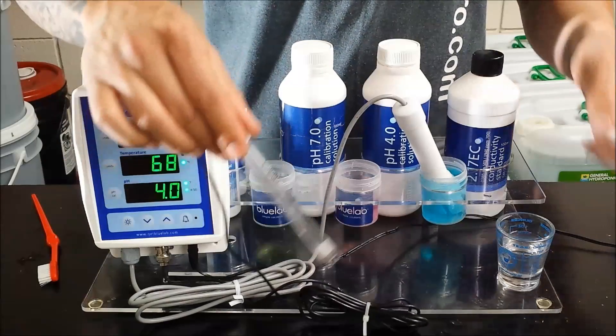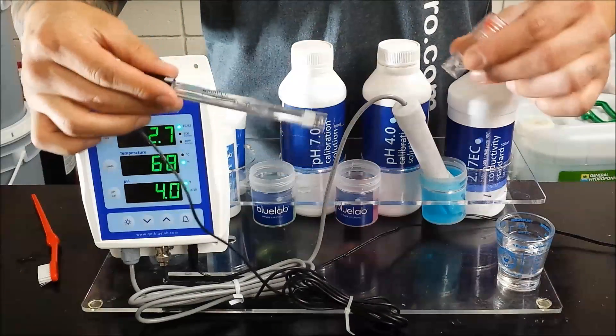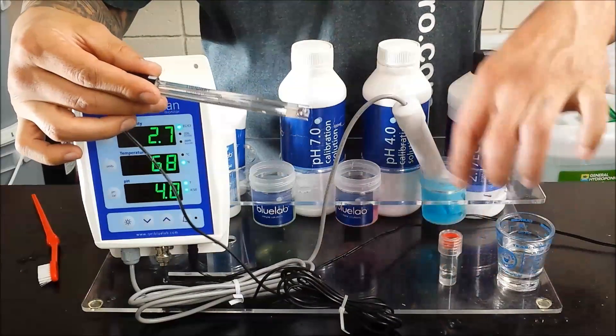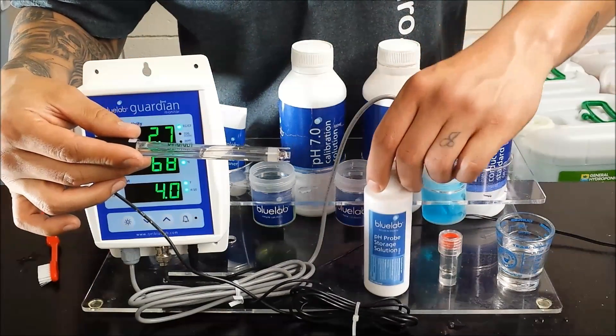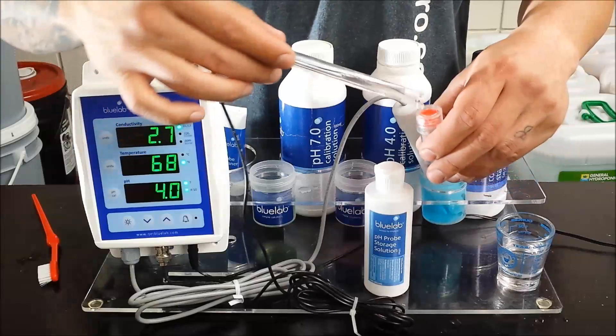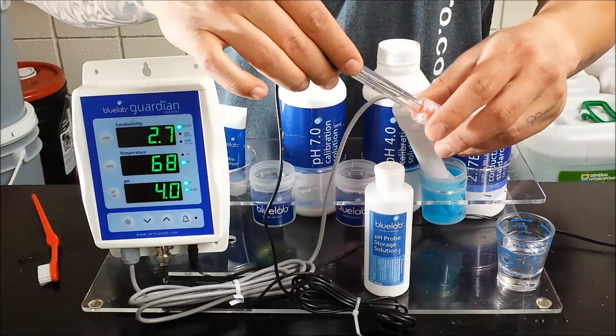And lastly before you do put it away your pH probe never let it dry. You want to save the cap and you want to use their Bluelab KCL storage solution to keep it moist. And that's it.